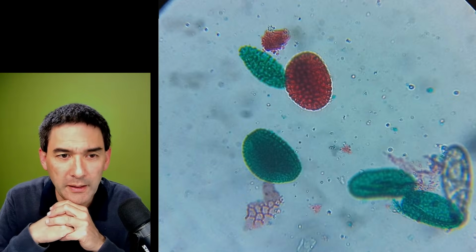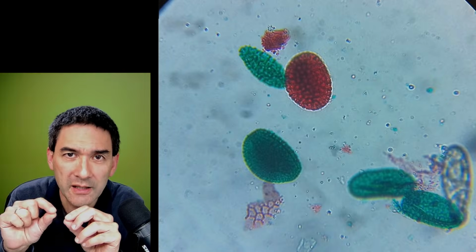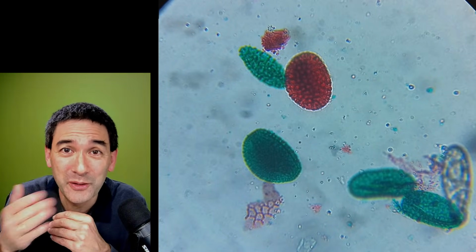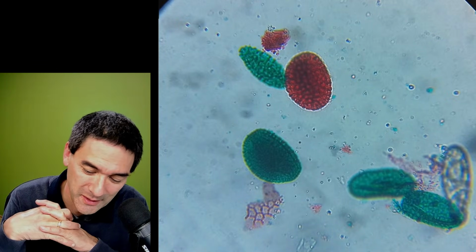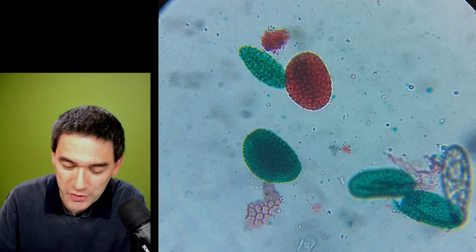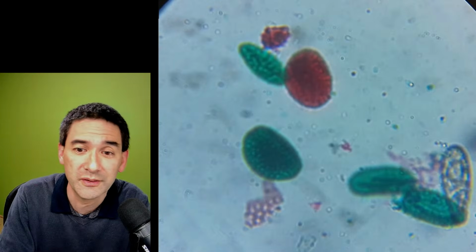So I have a proposal. I already mentioned this before. Of course, you might not be able to get all of the info on a microscope slide, but at least you can put on a QR code or something like that, which connects you to maybe a web page which gives you all of the information. That would actually be a wish. Now we've got a whole box of slides. At least we know what it is, but very little info on the type of preparation.